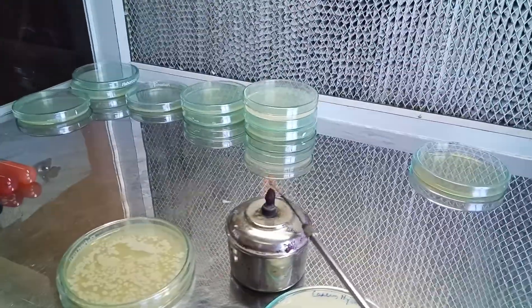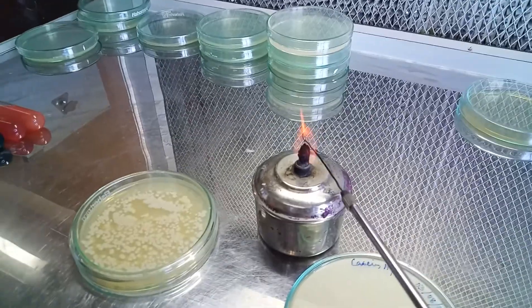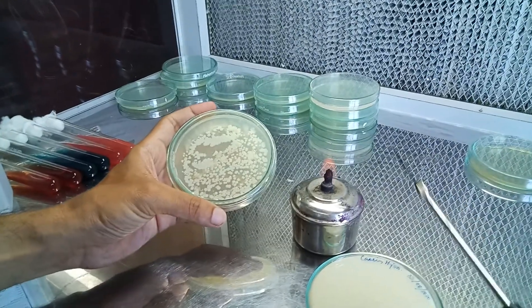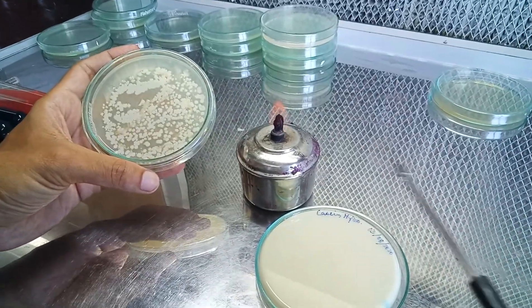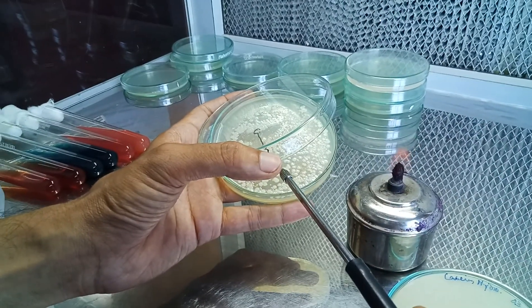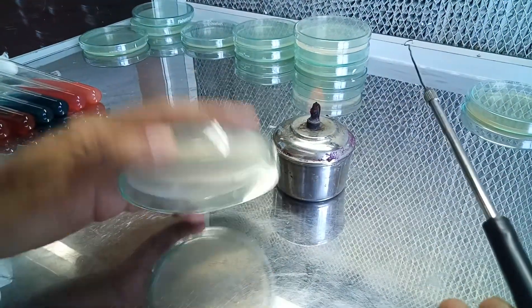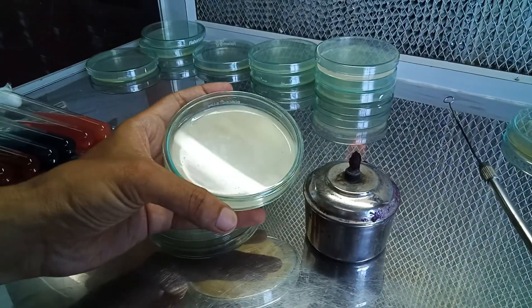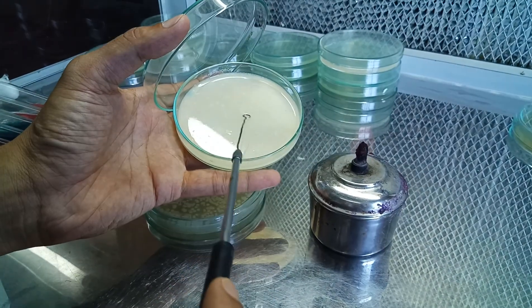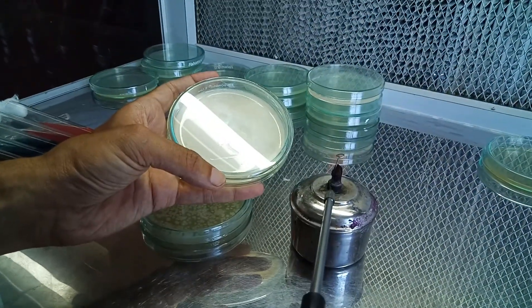We heat the loop and then cool it off. We'll take a very small colony, open the plate near the flame, and make a continuous streak. That's all — the continuous streak should be visible on the plate.